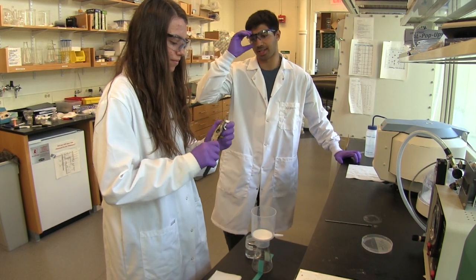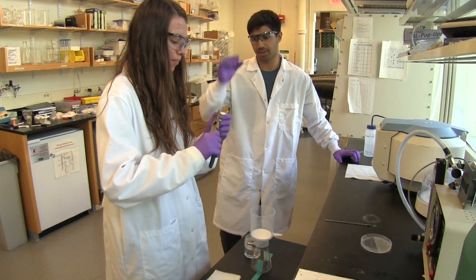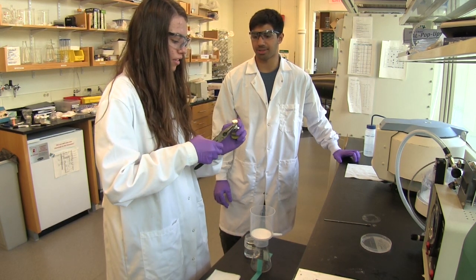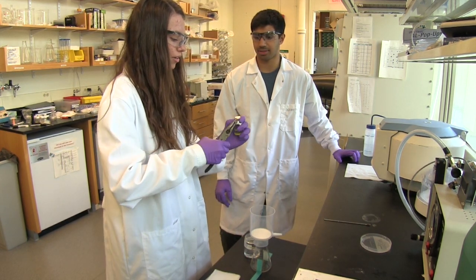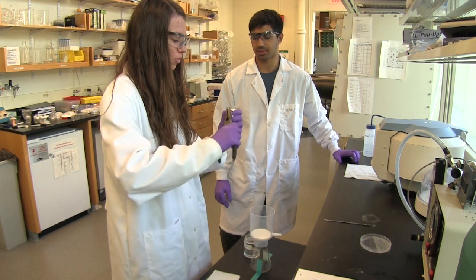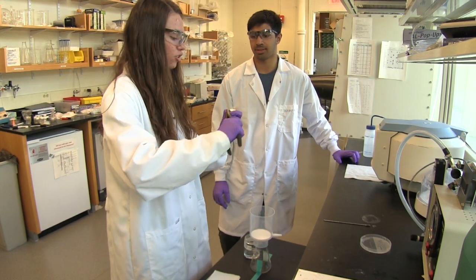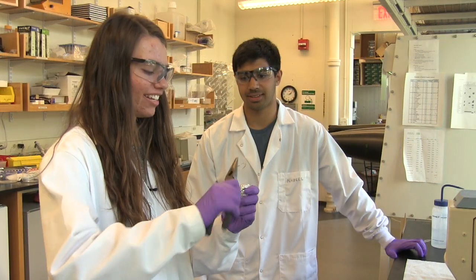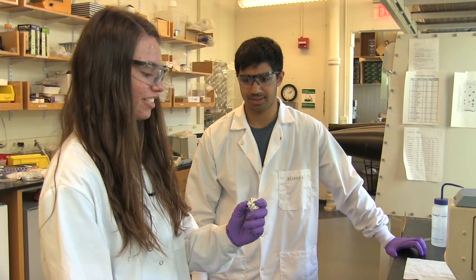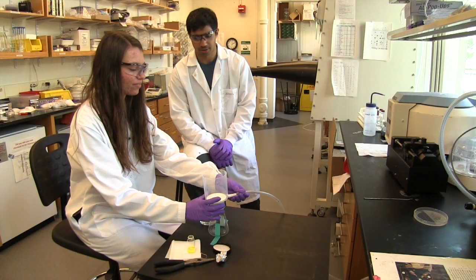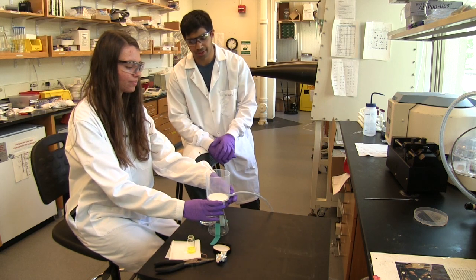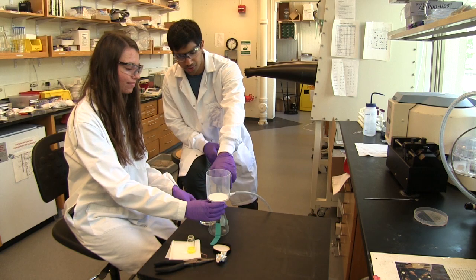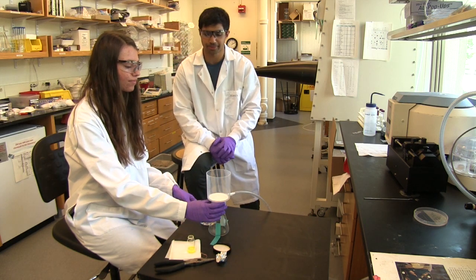So, why did you decide to use the tin foil for stopping your solution? I used the tin foil, and then I poked a small hole in it, and it controls the diffusion, so it's really slow. And I'm going to remove the foil. Right, so when you attach the tube, you've got to make sure that it's firmly attached. Otherwise, you won't pull vacuum through into the funnel.